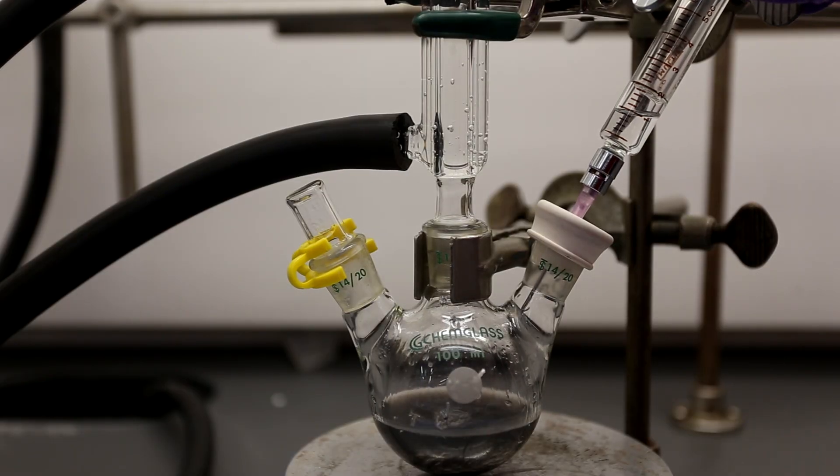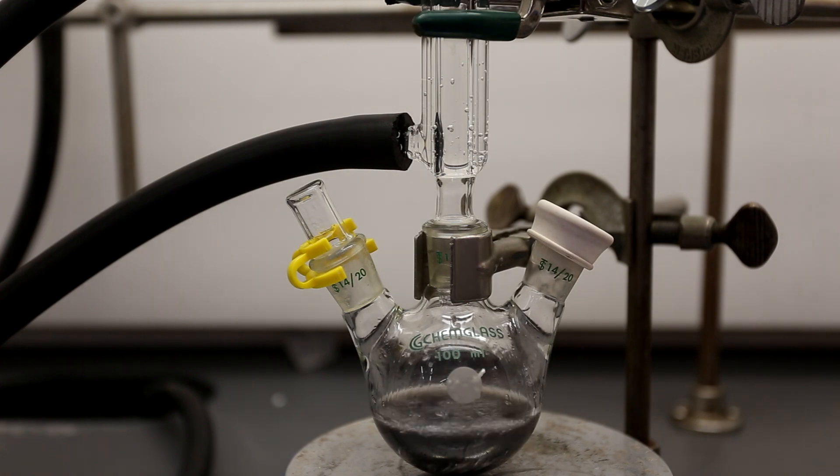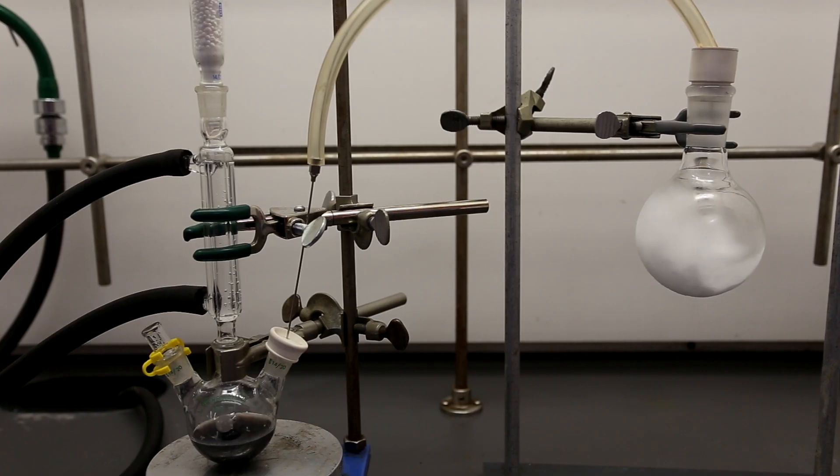Once the bubbling stops and the ether stops boiling, the reaction is complete and you can allow it to cool down to room temperature. Afterwards, a CO2 generator was set up using dry ice as shown.